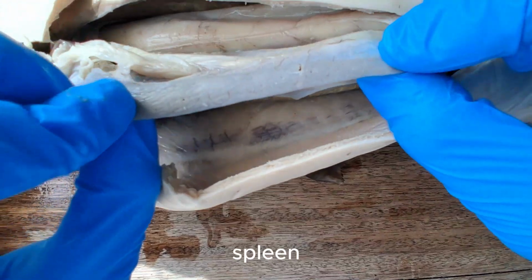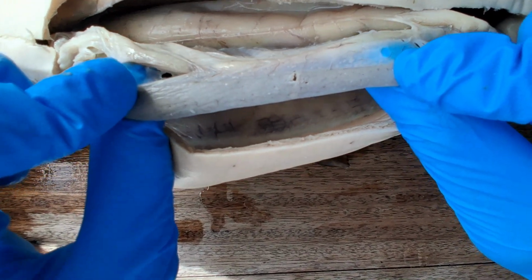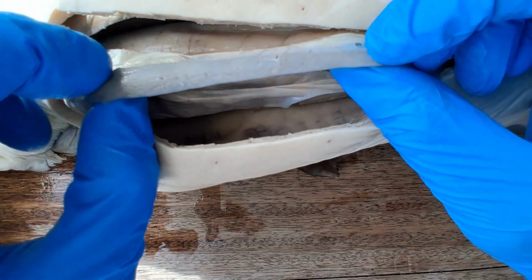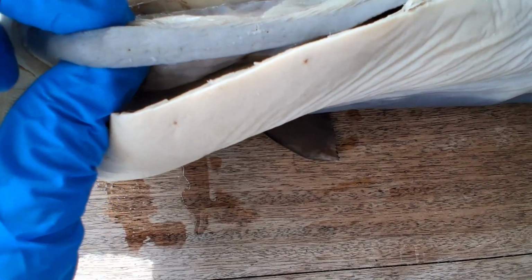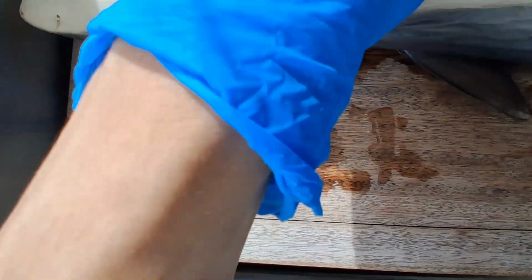The spleen. Same function all throughout the vertebrate subphylum. It breaks down old red blood cells. But in the case of fishes, they can also participate in hematopoiesis, or creation of new blood cells.